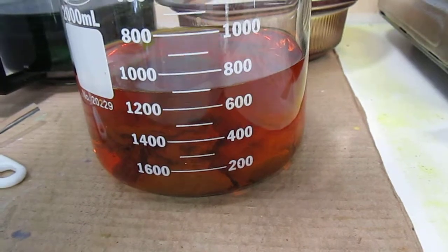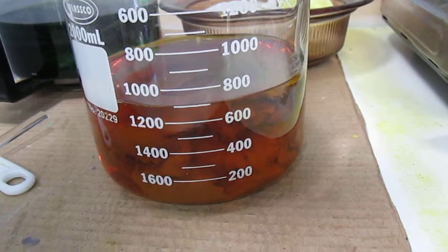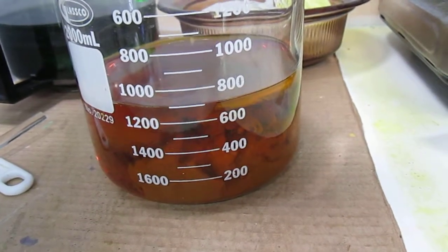Beautiful. Just beautiful. I like to add my sodium metabisulfite dry.